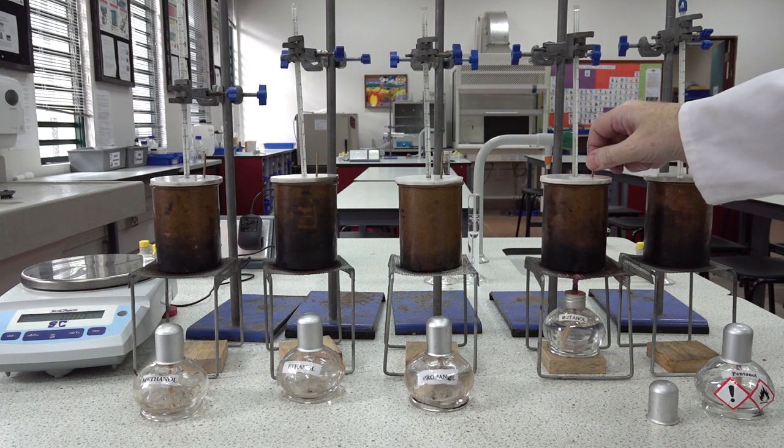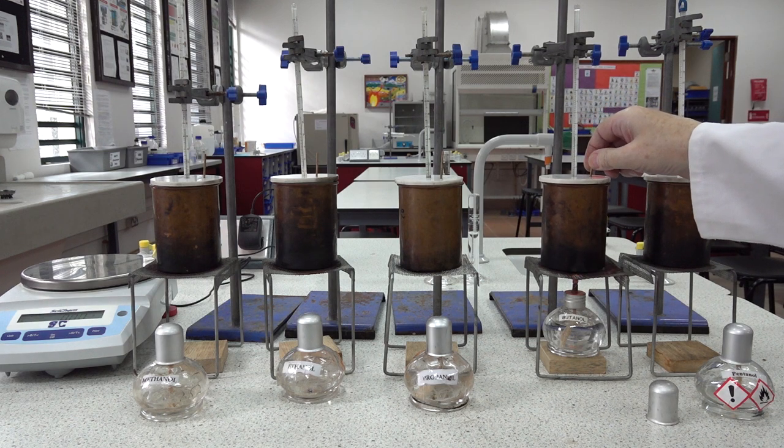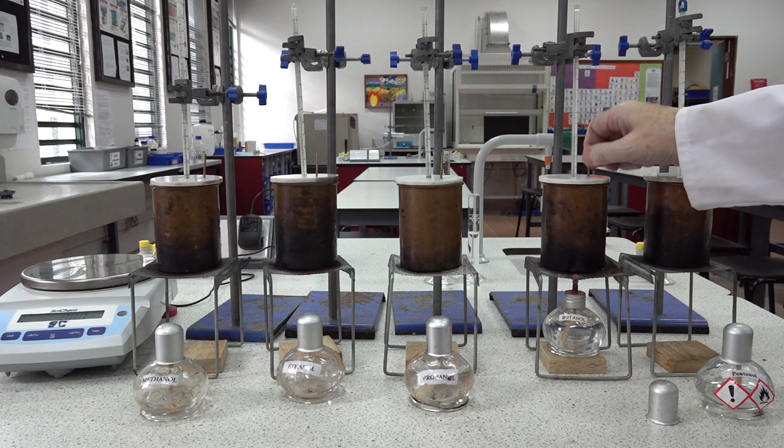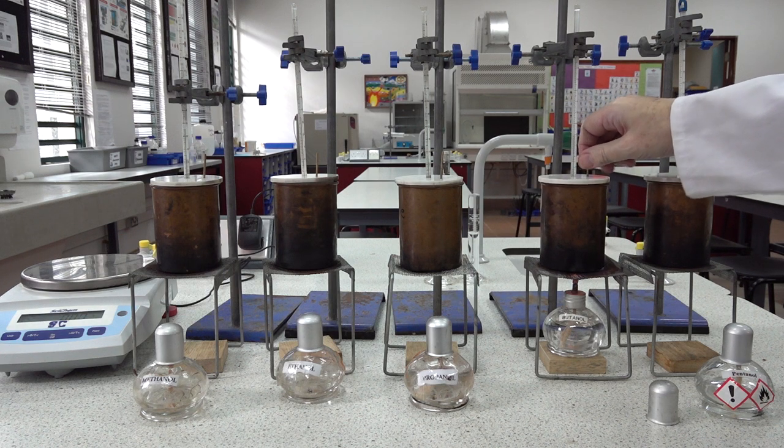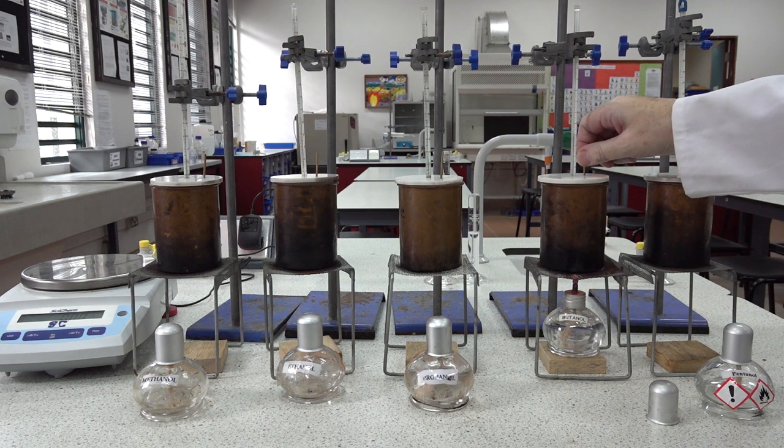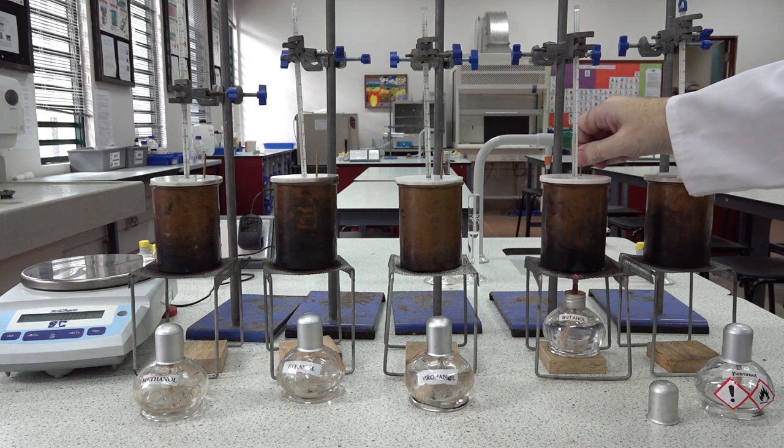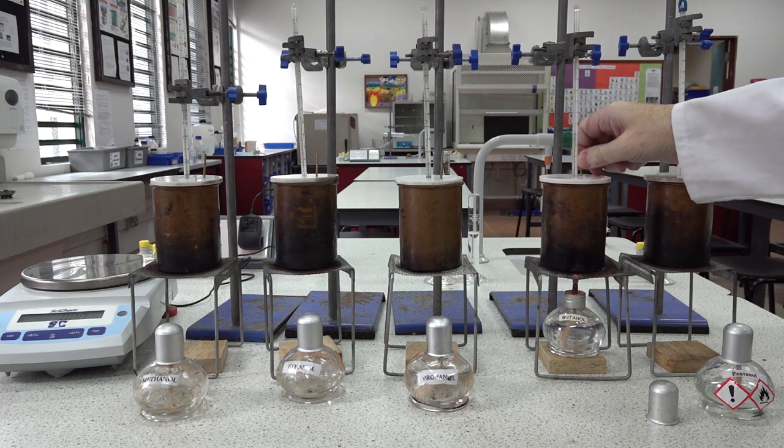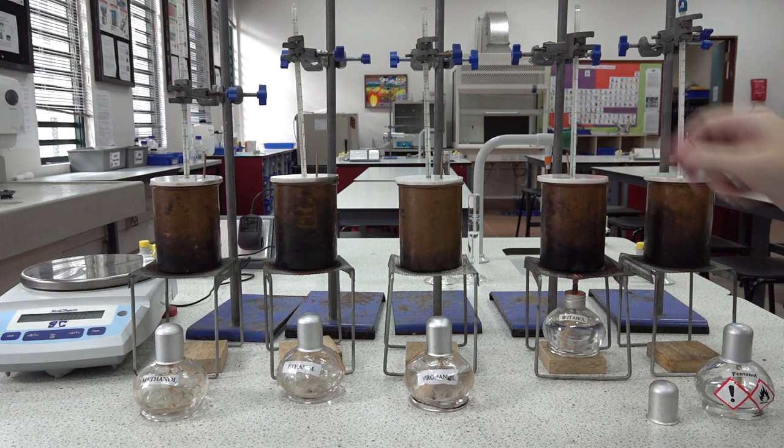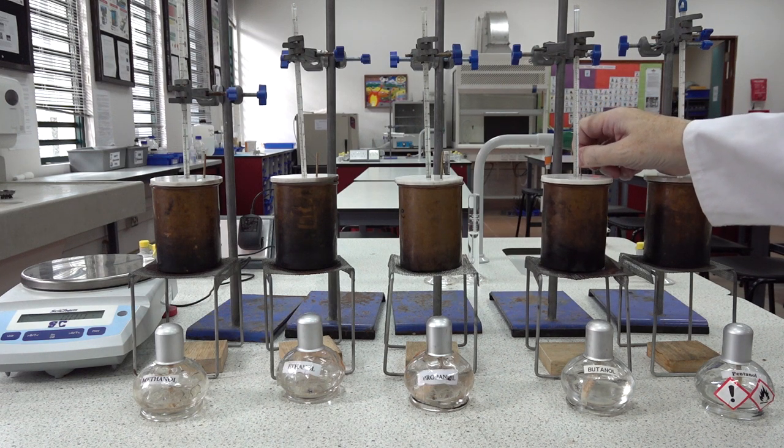We're at 27. 28, 29, 30, 31, 32, coming up to 33. And we'll take the burner out, extinguish the flame as we've done before, then keep stirring to see what temperature we can get to. We're at 34.